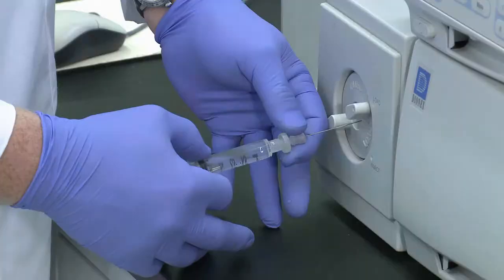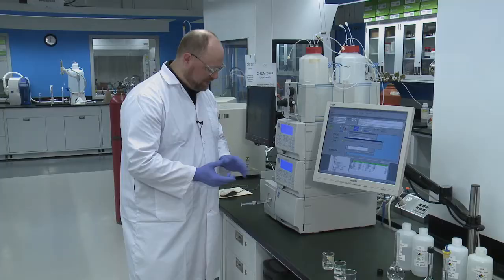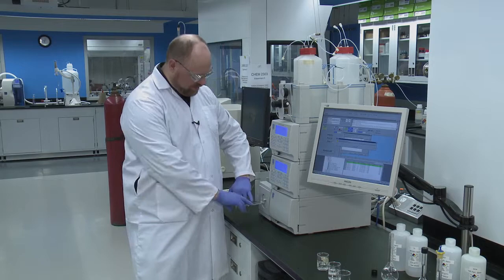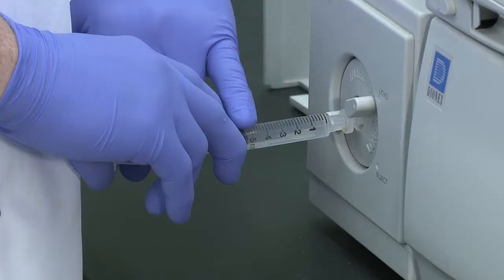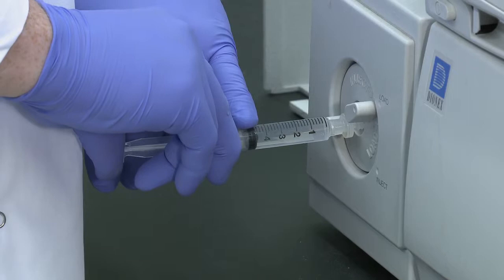Then you're going to insert the syringe into the injection port. Push it all the way in. And you're going to want to inject approximately a cc. This syringe still has gradations on it. But if not, the width of a pinky finger works fine. So you push to inject that.